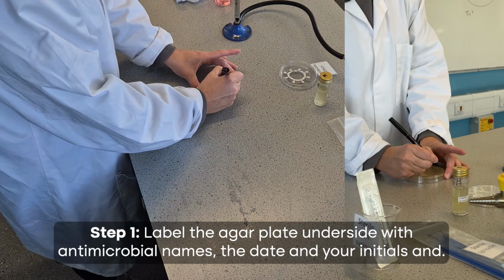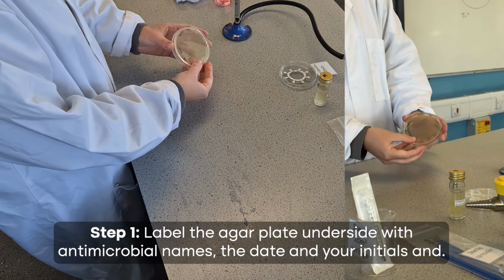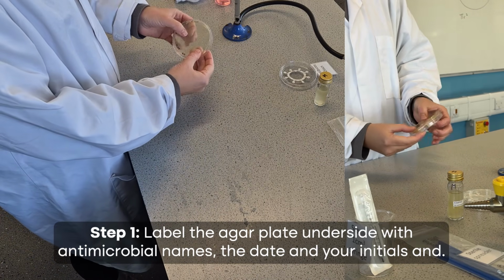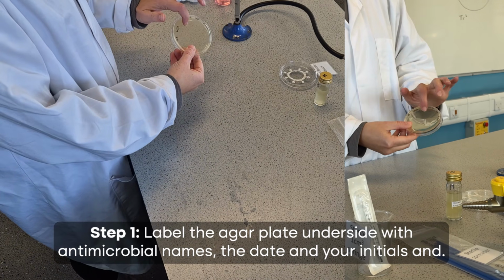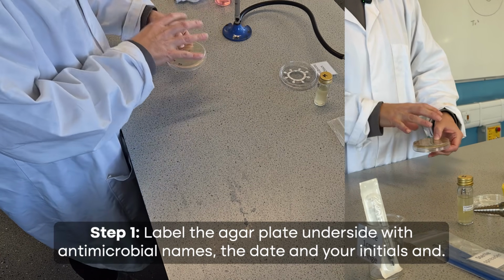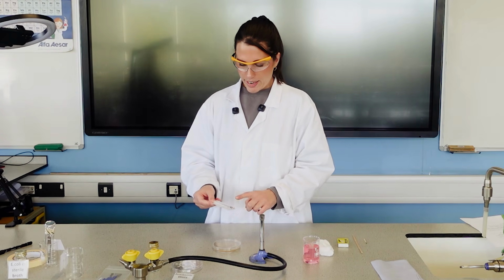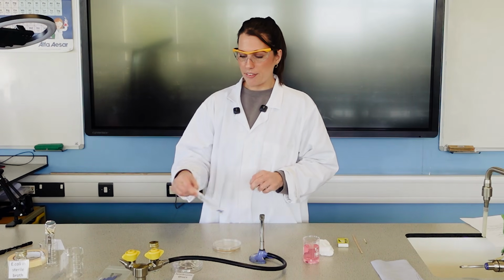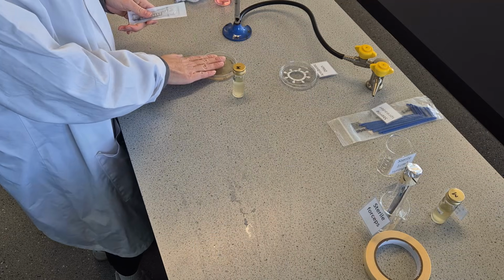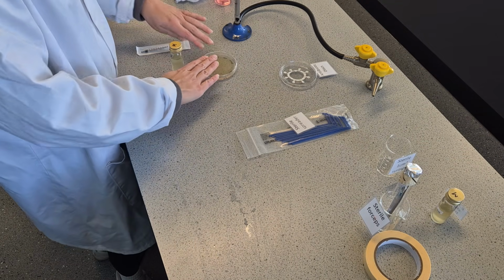And I'm adding E. coli. So that is now my new label that I'm adding to the bottom, at the corner, at the bottom. So if the lid does fall off, we still know what is on the actual agar, and right at the edges so it's not blocking your plate and your results at the end. So now I'm ready to flip it over. So I'm now ready to get my bacteria from my bottle into my plate, and I'm then going to spread it evenly across the bottom.